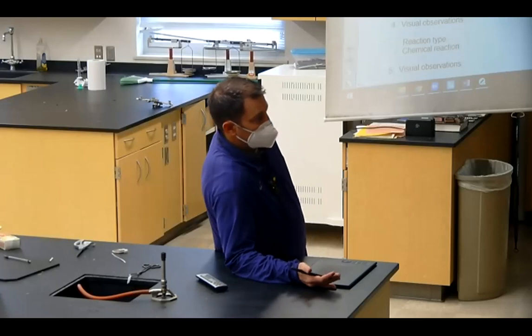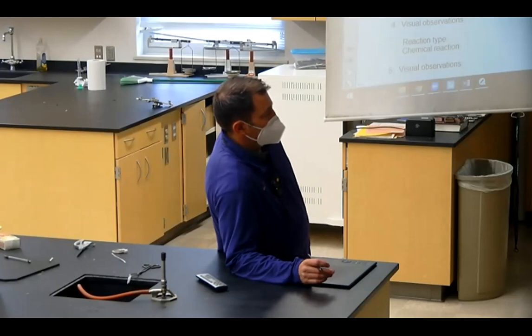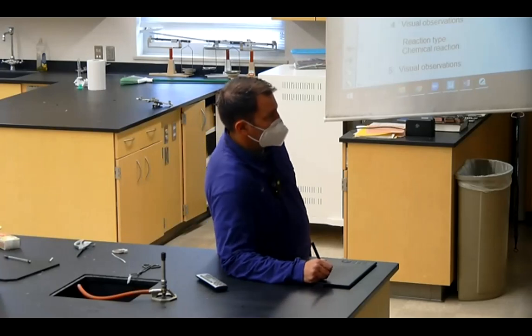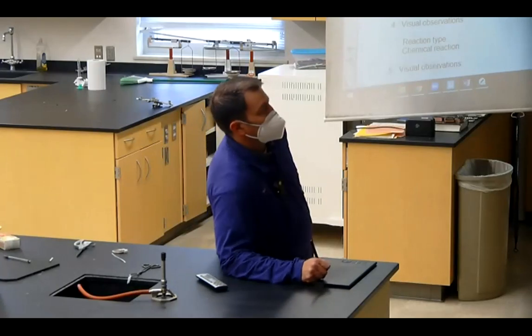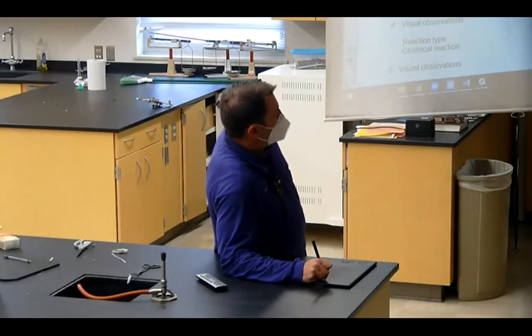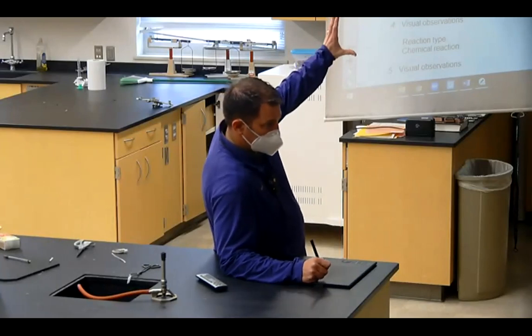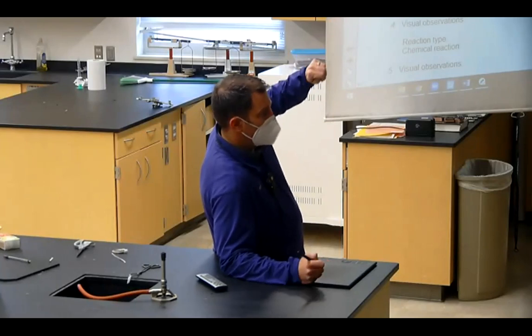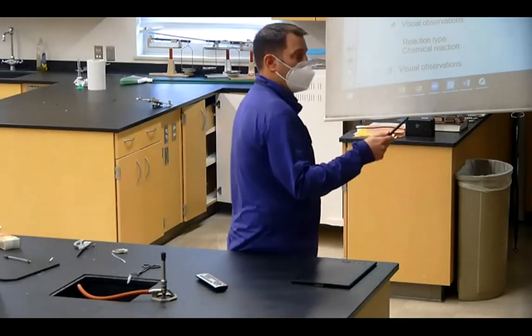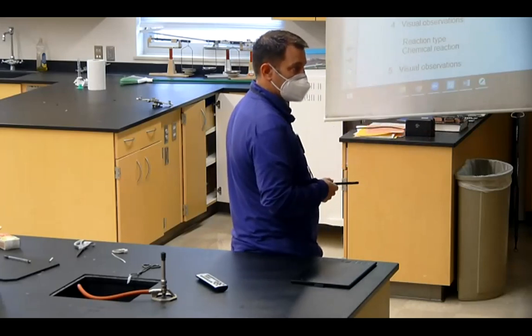It literally is exactly the same process for making a solid fuel rocket motor. We took an enclosed space, that's the test tube. We took what's an oxidizer, or something that produces oxygen. We put in a fuel, that would be the wood, and then we lit them on fire. And that noise literally is the sound of a tiny little rocket in my hand. Now, it doesn't push very hard. The shaking, that was me. But there was twice where it did push away from me when it tried to eject the wood pieces. And that's kind of when it got stuck too.